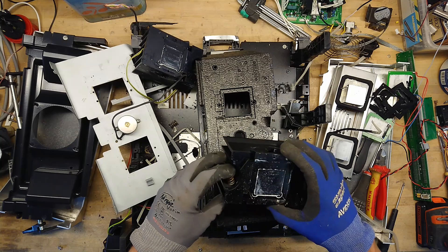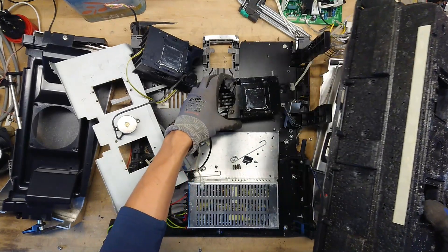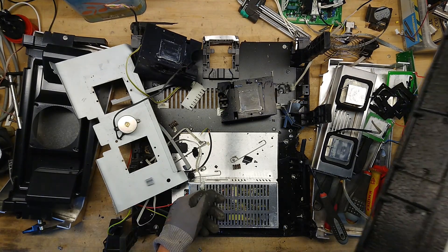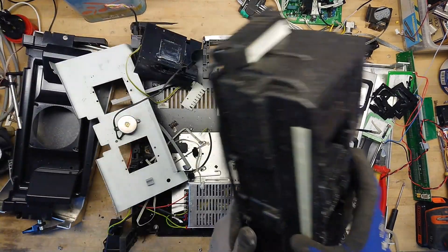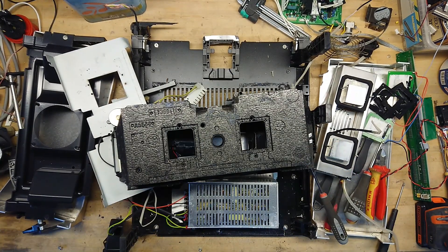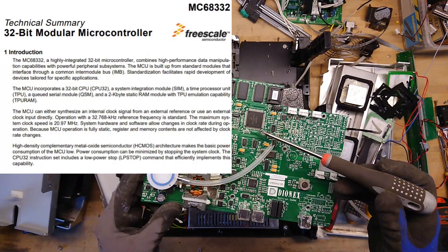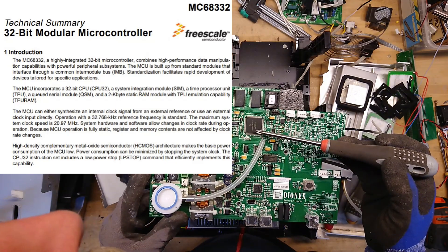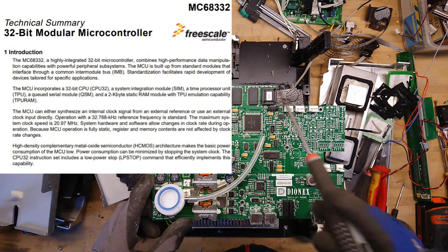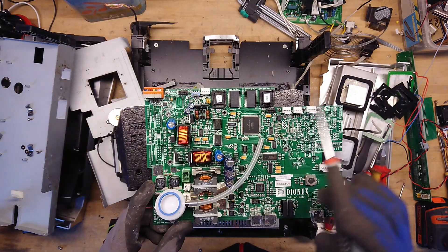So overall, quite a disappointing product — not that it doesn't work, but there aren't really any exciting parts except maybe the 24 volt DC power supply and the two Peltier elements. Let's take a look at the control board. It uses a Freescale MC68332 microcontroller with some extra peripheral chips — it says SRAM and flash memory on the other two chips.